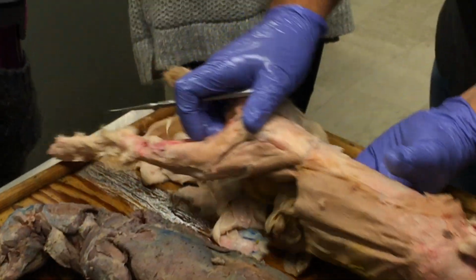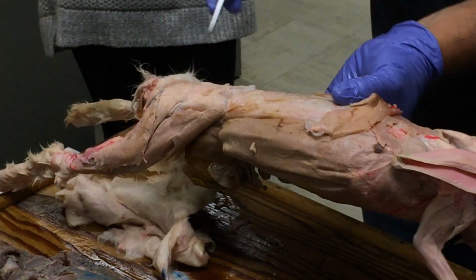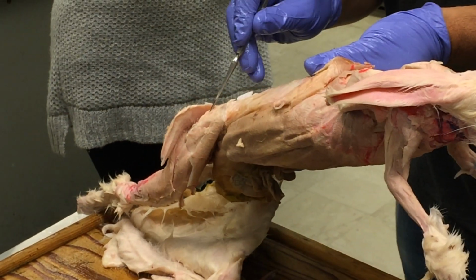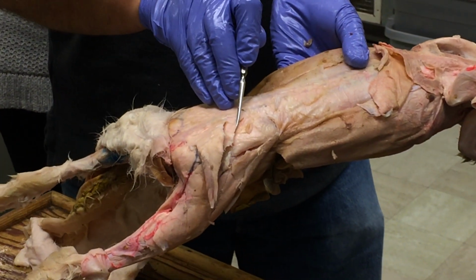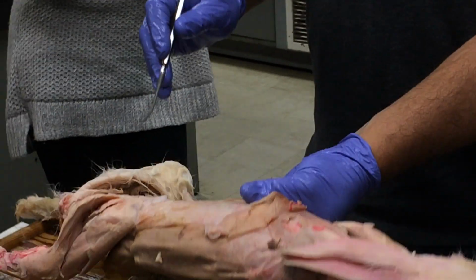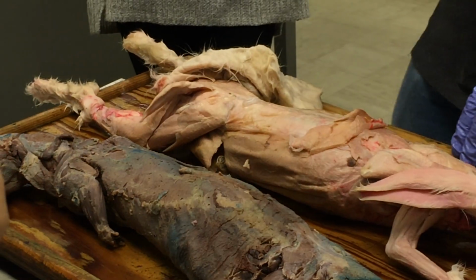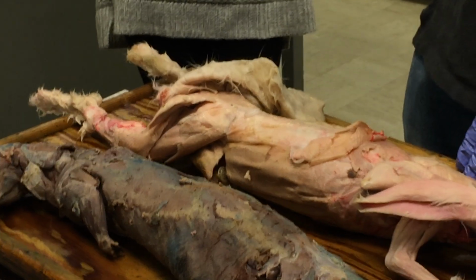And on the rabbit, kind of the same deal. Here's gluteus medius, this big guy here, and the superficialis is this component in here, which is actually separated off pretty nicely. You see that? That's the gluteus superficialis. Okay. And the glutes, in general, if you look at what they're doing, they're basically going to be abductors of the hip joint. They're basically pulling the leg out to the side.